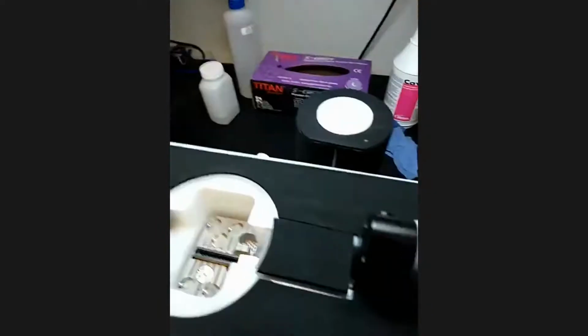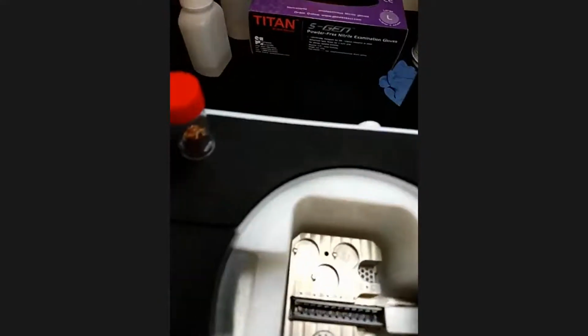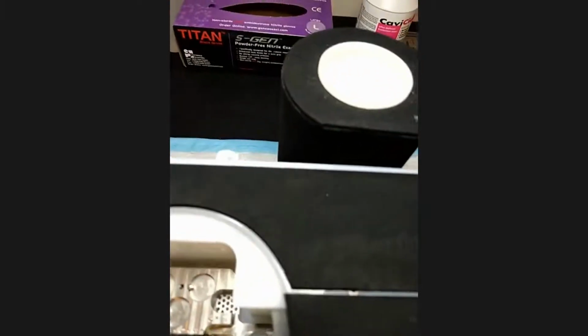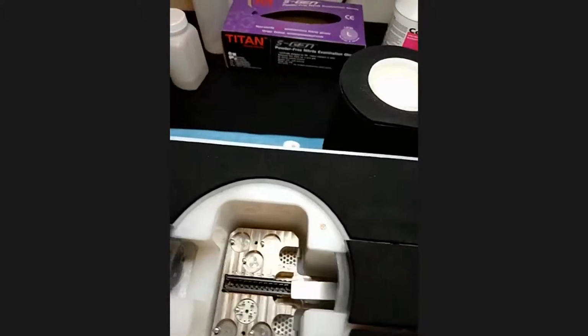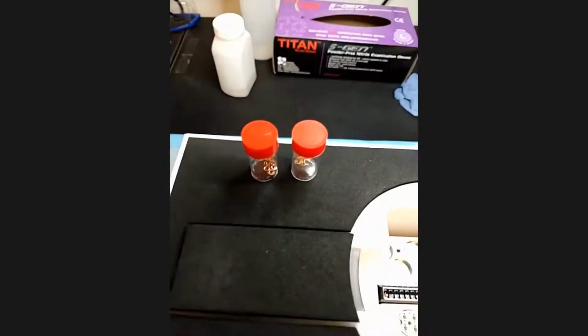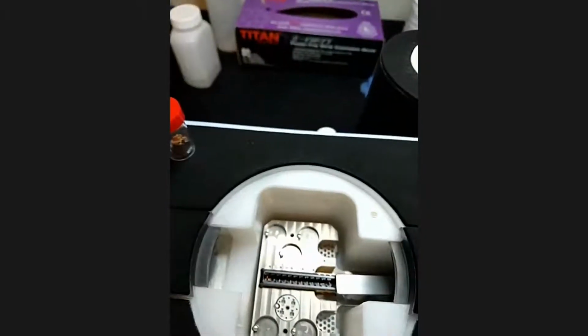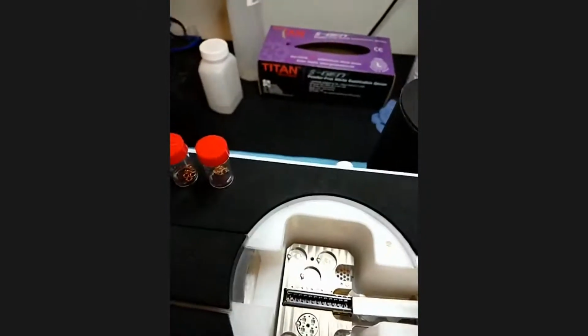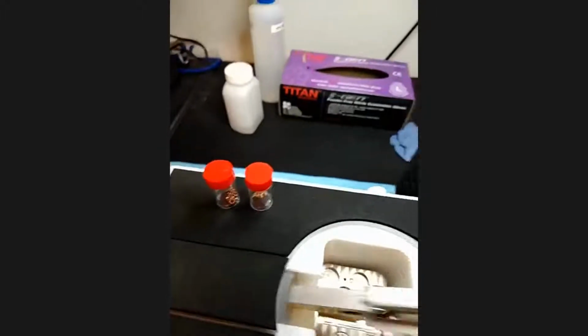We put the things in the grid that doesn't even show up well on the phone camera. And it's actually made of these clip rings and these base grids, and we put those in the cassette, and the cassette is loaded into the cup just like this one.